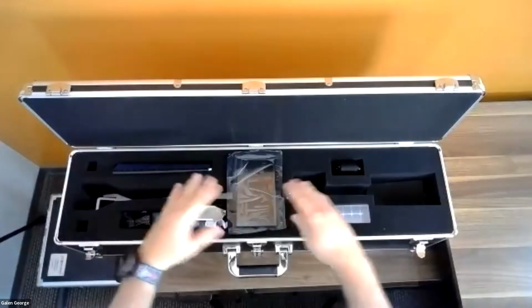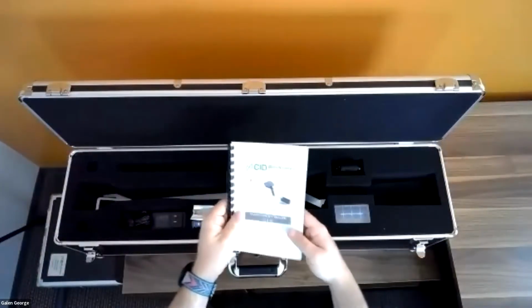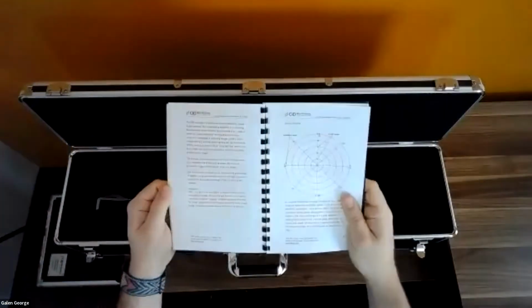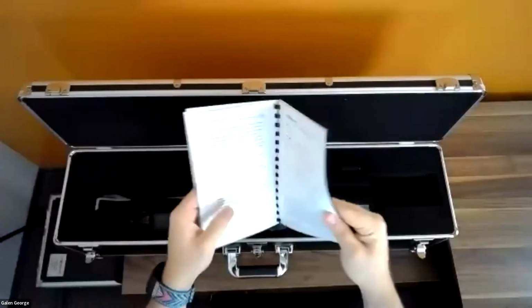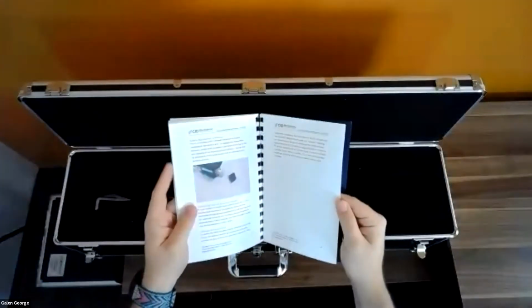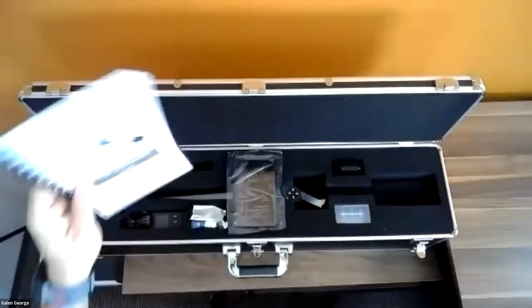It's the long elongated rod right here with the actual screen. We have a manual, an actual printed hard manual that comes with it. So in this manual, you can find lots of good information about the theory, as well as the menu structures, what each menu does, as well as the actual calculations that we utilize in this device, and some troubleshooting tips, battery replacement, and all that kind of information, all located in the manual.